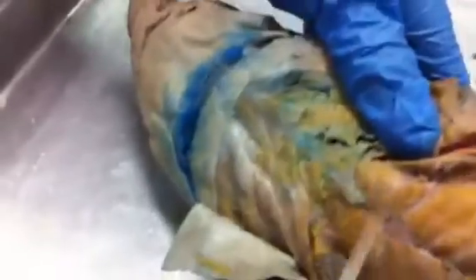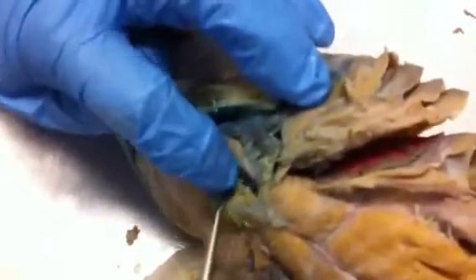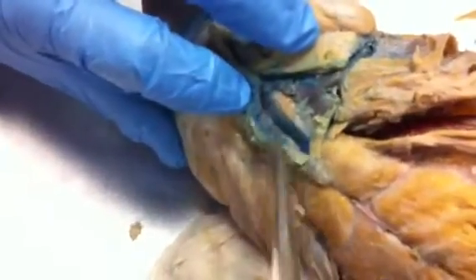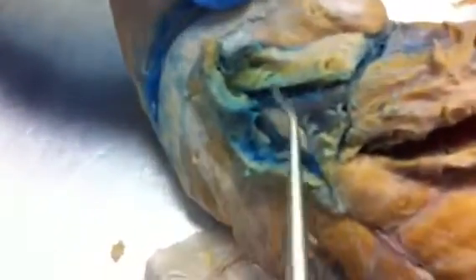Alright. So, these things are the coracoarcuals right there, okay? And the muscles that run deep from the coracoarcuals to the mandible, these ones right here, are known as the coracomandibular muscles because they go from the coracoid to the mandible. Then the ones underneath them, these bands of muscles right there, these go to the second arch. Yeah, these go to the second arch. So this little kidney looking thing is the coracohyoid muscle.